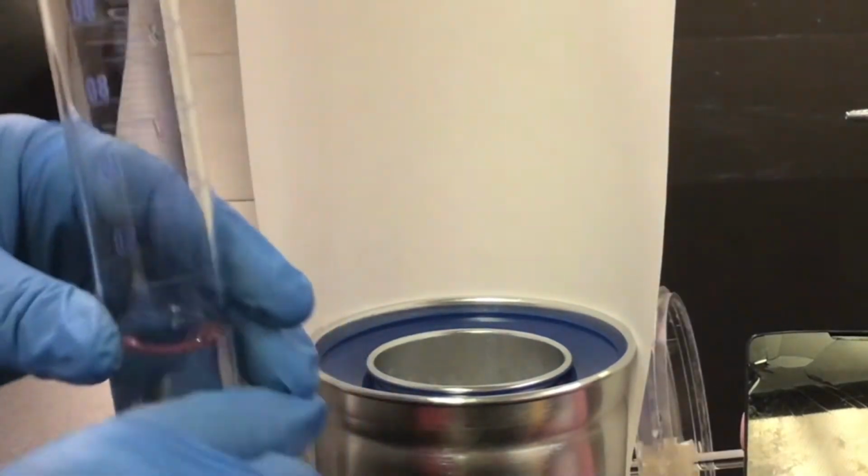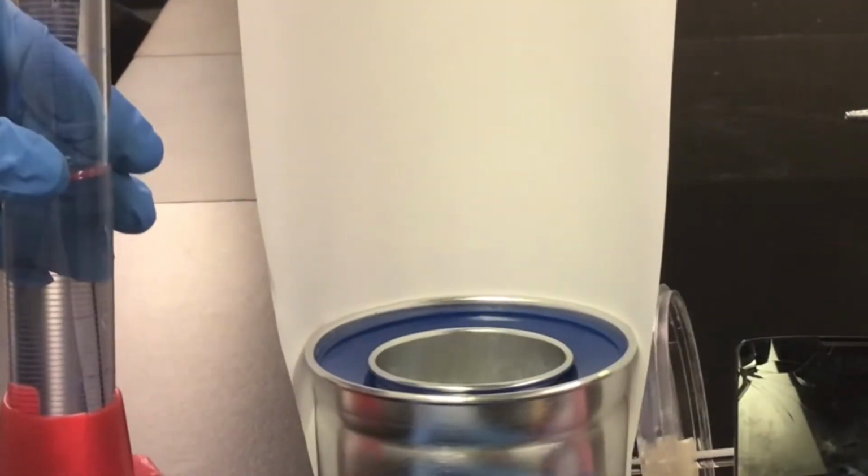Next, we will pour the base and the acid into the calorimeter and record the initial temperature of the mixture. You are to use the temperature of the acid as your initial temperature. While stirring the mixture, you will record the temperature readings every 10 seconds until the temperature remains constant.